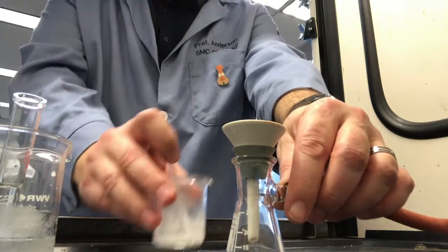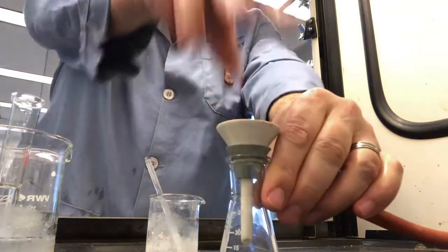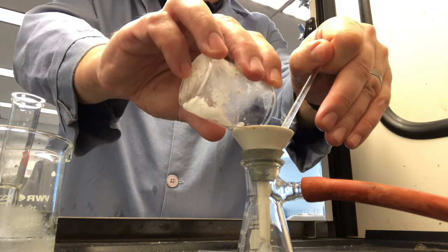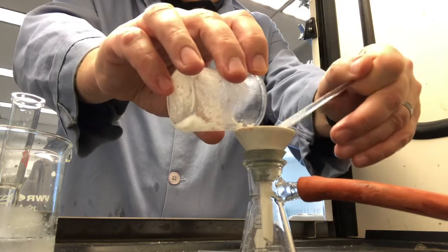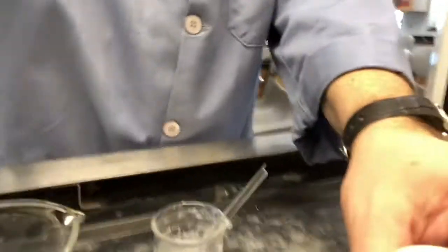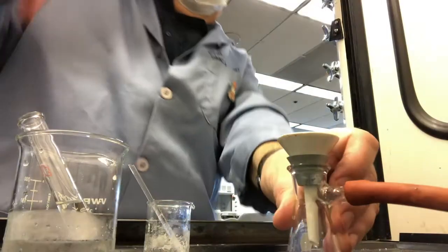A broken stirring rod. Make sure that the vacuum is on and that the filter flask is sealed tightly. You can see I made this harder on myself by not having a clamp that held the flask still while I pour. So I'm having to hold the filter down so it doesn't fall over, spill my product all over the hood. This way you're able to see the solid that's collecting on the filter. Nice white solid. There's quite a bit of it still left in the flask.